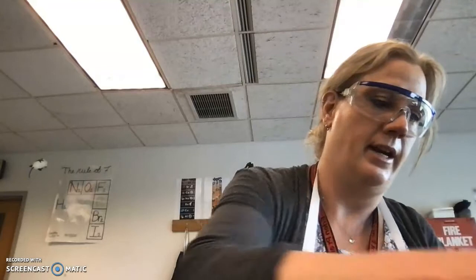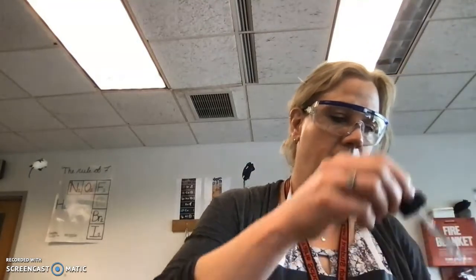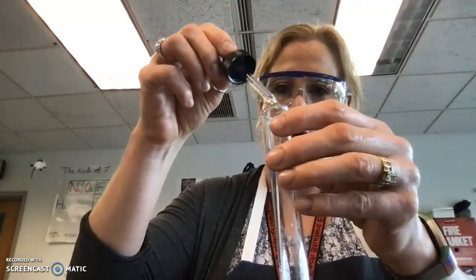One more trial of the same thing. We'll add our phenolphthalein and add these drop by drop.